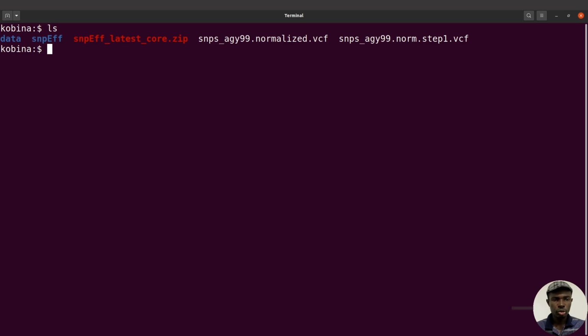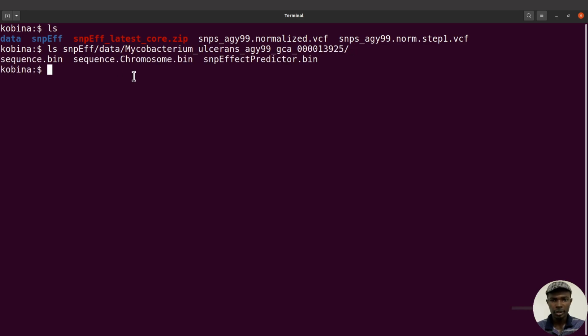So to do that, let's look at the database which is here. So let's ls into snpeff/data/ and specify the name. All right, so we have that information. So what we need to do is to check the name of the chromosome, that's the sequence name that has been given in this database, and compare with what we have in our VCF file, and we'll be able to provide a solution to it. So that's what we are going to do next.